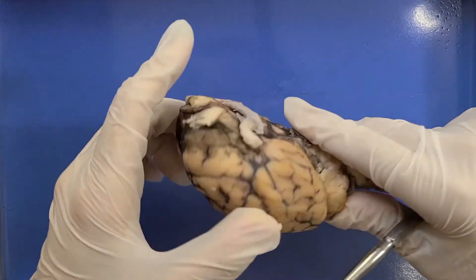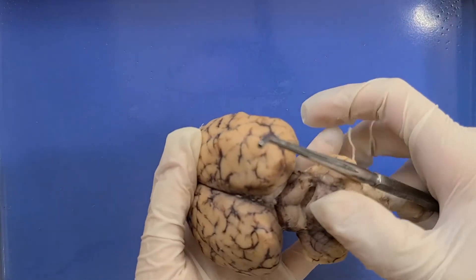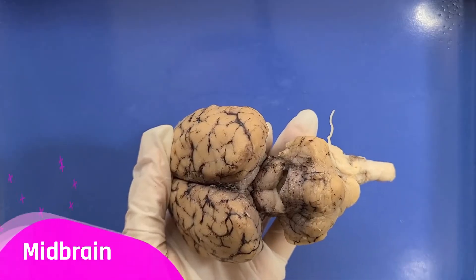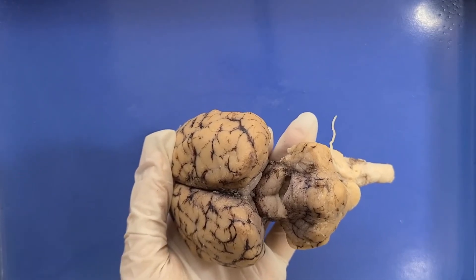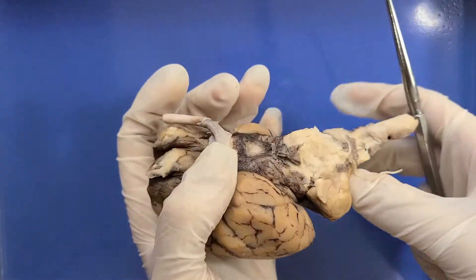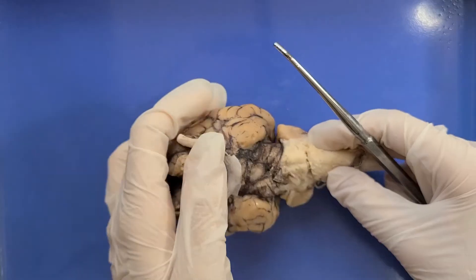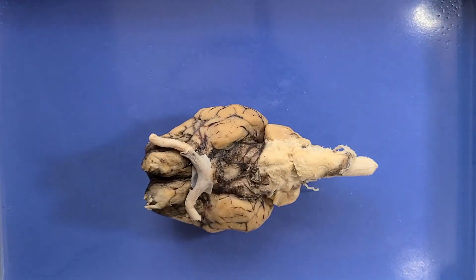To see it, I'm going to flip it over and pull back this structure, and now you can see these four bumps here are the midbrain. It's involved in a lot of sensory processing. It's worth noting that a lot of these functions overlap between parts of the brain and the brain constantly communicates within itself, so these are just generalizations.